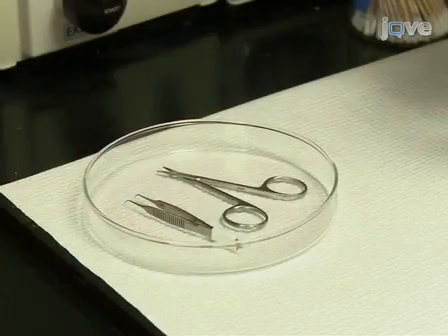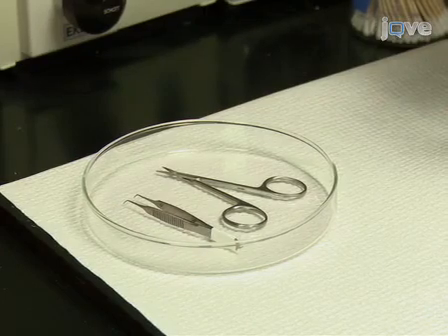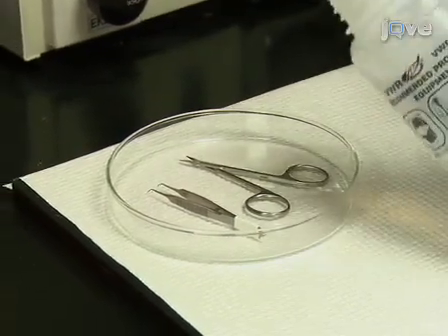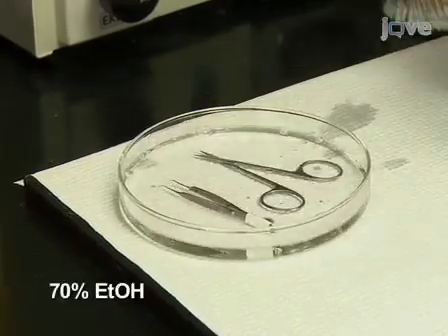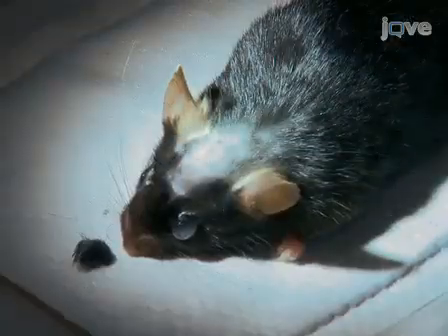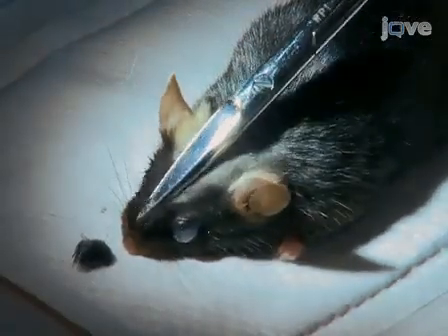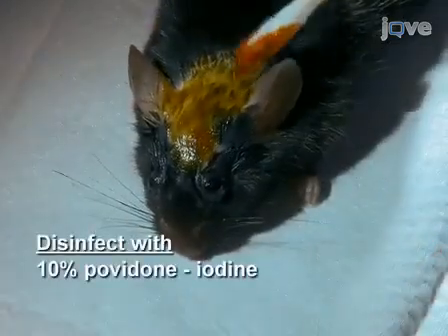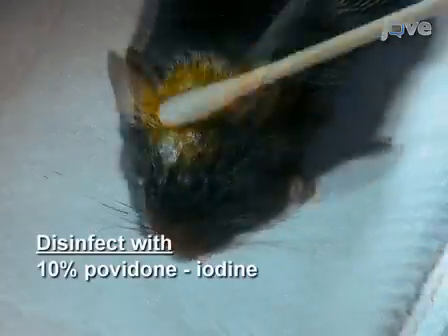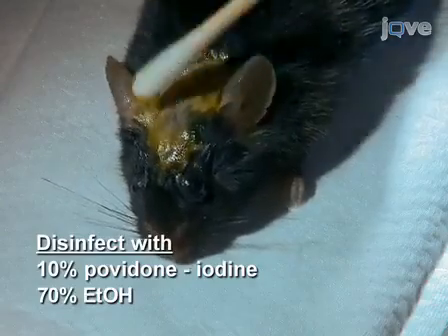All surgical instruments should have been autoclaved or sterilized with a glass bead sterilizer. Further disinfect the instruments by soaking them in 70% ethanol. Using scissors, remove the hair from the animal's scalp. Then, disinfect the area using a 10% povidone iodine solution and 70% ethanol.